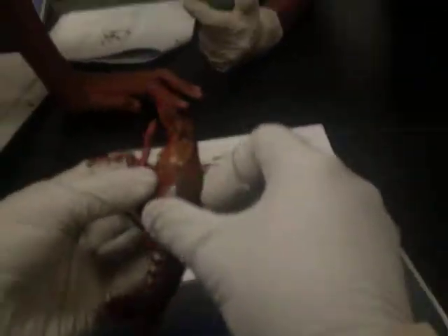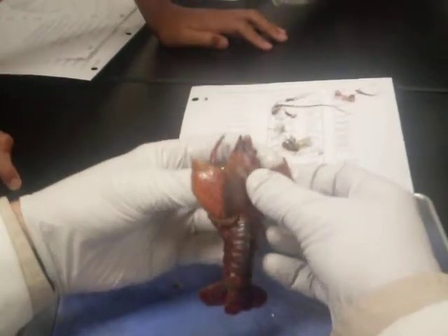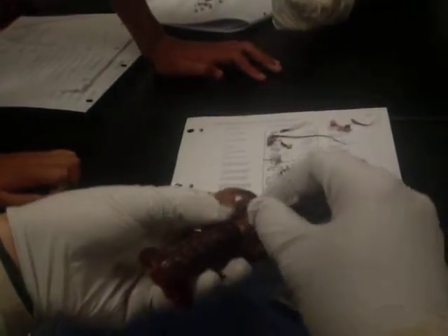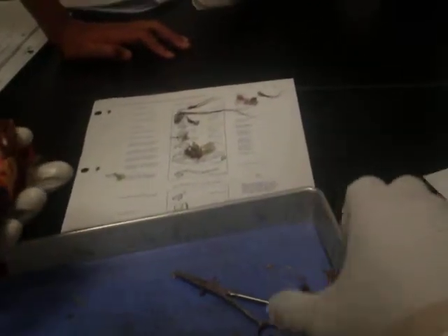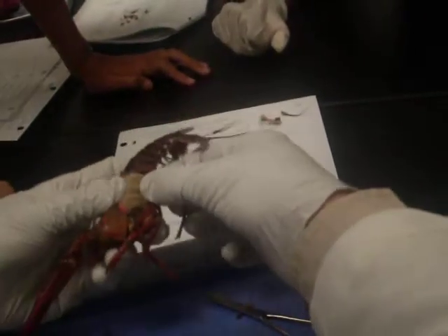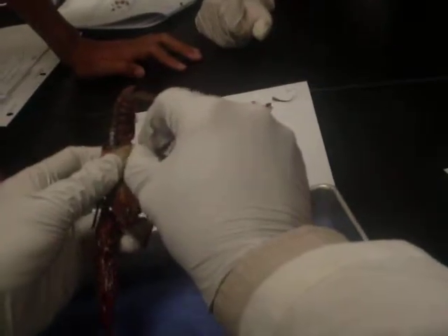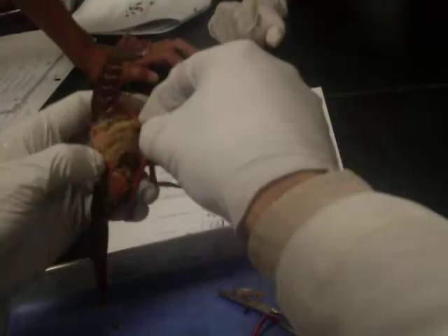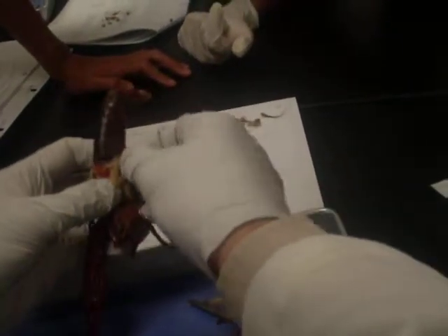Okay, very easy. Right along the edges, right? You're not over here — you're on the other side of the room. Now you take and at the base, if you do it carefully. There we go. See the gill come right on it.